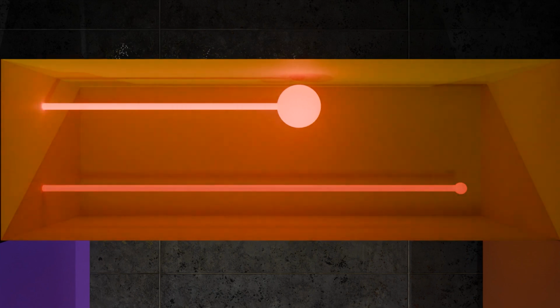How? Well, if you start with the molecules at the start, apply the field, then they will accelerate in a certain way. Now, after a certain amount of time, we stop and measure how far they went. Now that tells us how much they accelerated, and that in turn tells us how high their charge to mass ratio is. Or at least it would, if not for the fact that it actually assumes something. It assumes that they all go in parallel. That's because if they were not going in parallel, then this angle will actually screw up the distance.